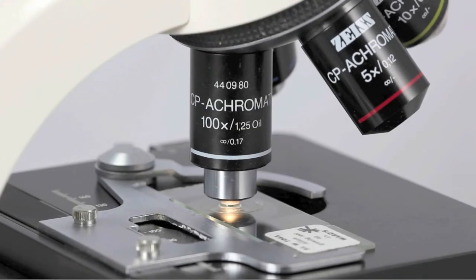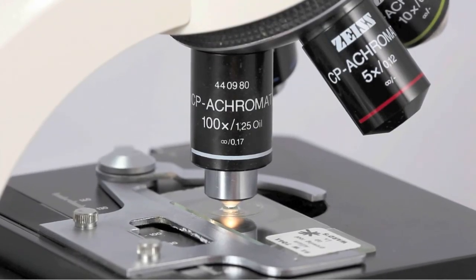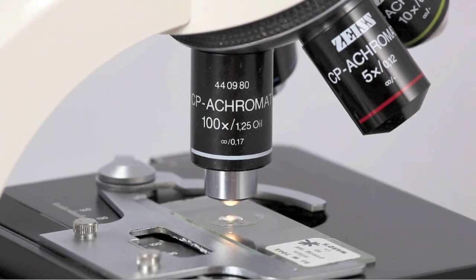Clean up requires special procedures. Once you're finished, lower the stage so that the lenses are well out of the oil.